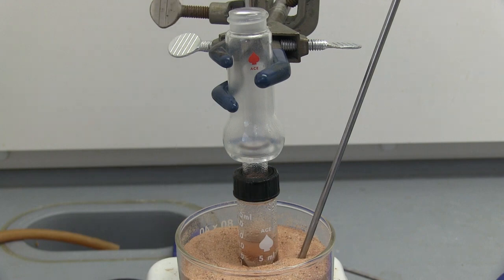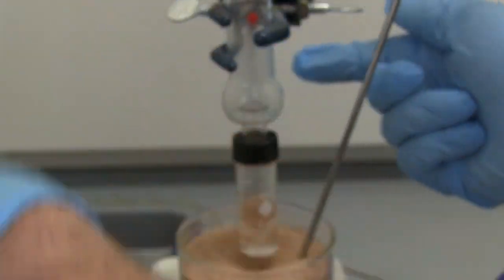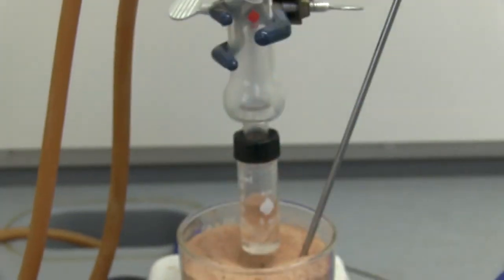I have a pipette, long end on it, and a small test tube. And we're going to get just the liquid that's in the side there, and put it in the small test tube. Looks like about a mil. We're also going to move this out, so as it begins to cool down, I'll put the water condenser back on just to condense anything that comes back out, so there's not much gas coming out.